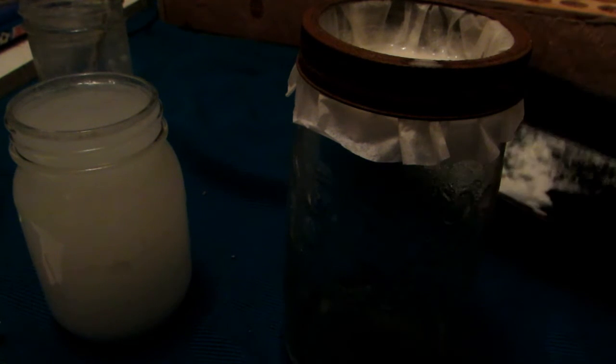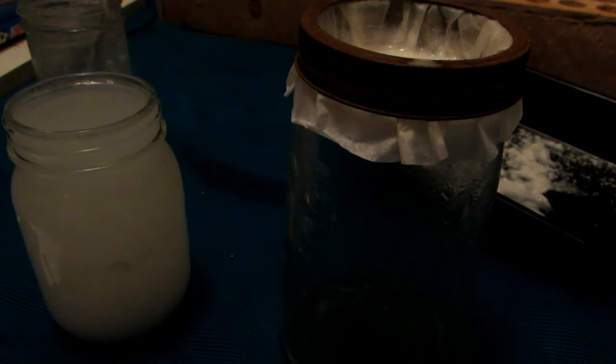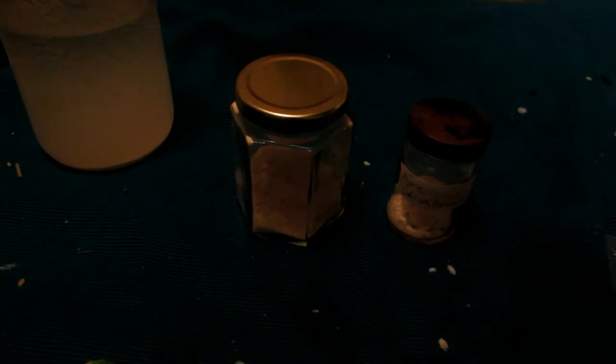We can get the oven heating up to about 400–450 degrees Fahrenheit because we really want to heat this enough to get rid of all the moisture. But upon too much heating we will decompose it into calcium oxide, so don't heat it with a blowtorch. Make sure you heat it in an oven. Alternatively, you could dry it out in open air over time, but the longer we leave it exposed to air, the more it degrades — when in contact with carbon dioxide it will form calcium carbonate and water. It doesn't have a super high affinity for CO2, but it'll still degrade.